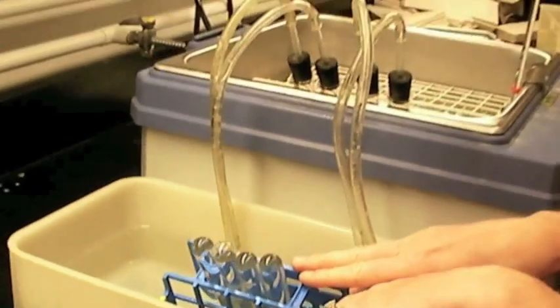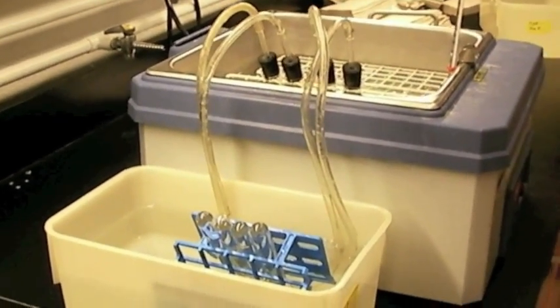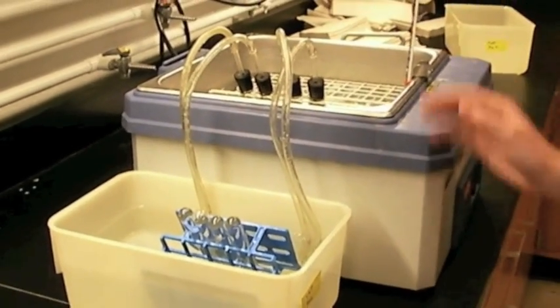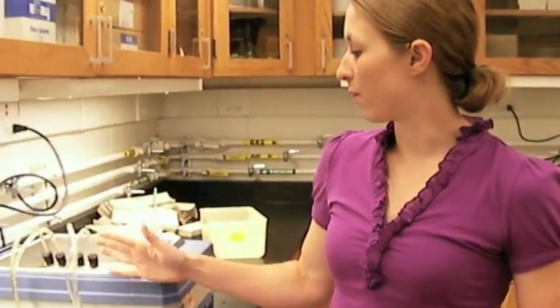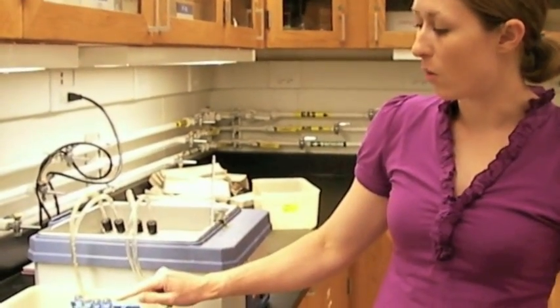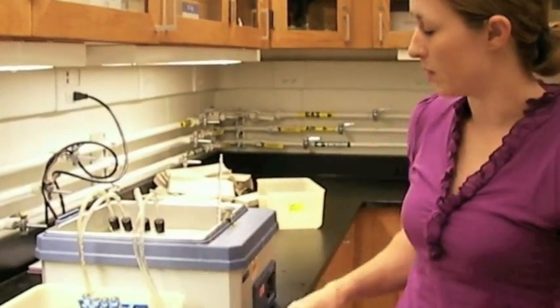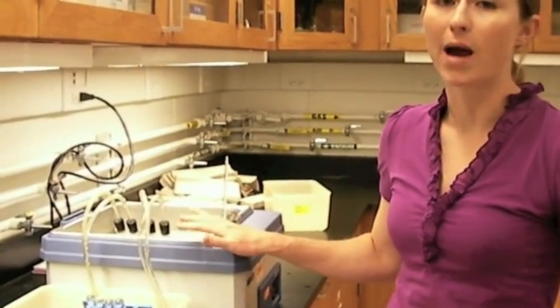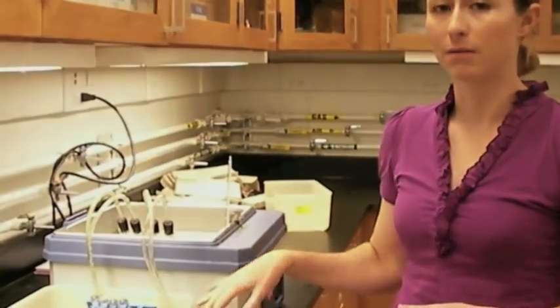Now, my apparatus here looks like it'll stay like that for the entire time. Once the time period has finished up that you are doing the fermentation reaction, you're going to measure the water displacement with a ruler in the test tubes. And it might be easiest just to leave the whole apparatus the way it is and measure it and then take it all apart.